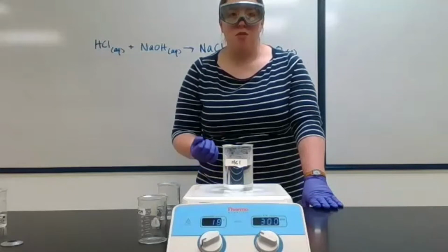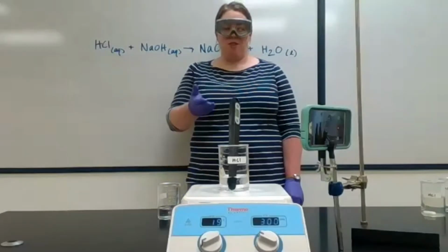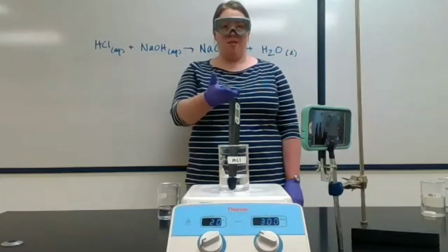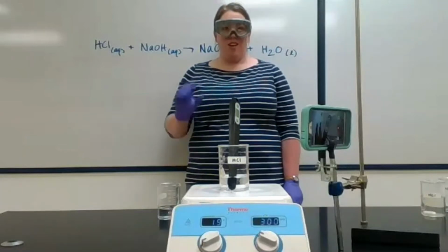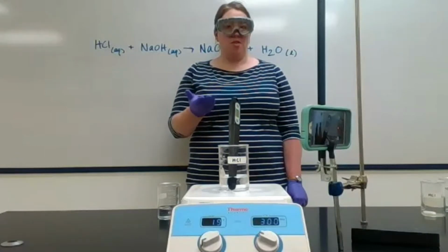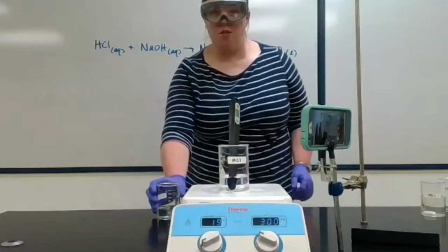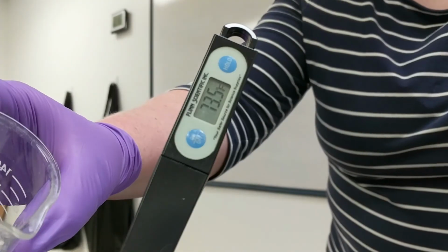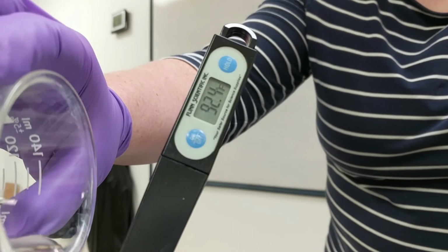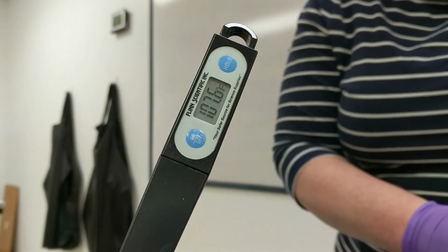Now I'm going to do this chemical reaction with a thermometer in place. All right, I've got a fresh beaker of HCl here, and I've got a digital thermometer in it, and my phone set up to record a close-up of that digital thermometer. And it's measuring right now just the room temperature, about 74 degrees. And now I'm going to add the NaOH. And you'll see the temperature increasing.